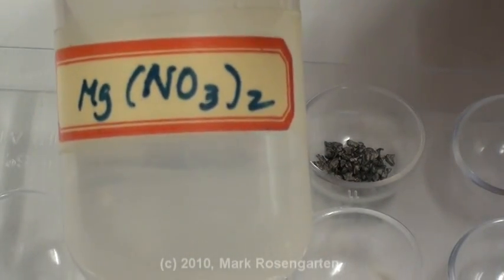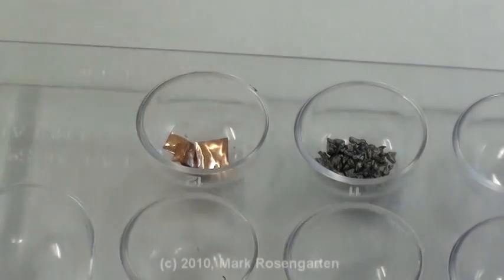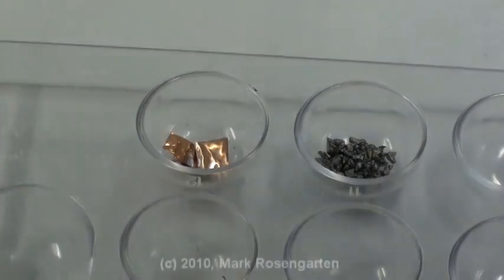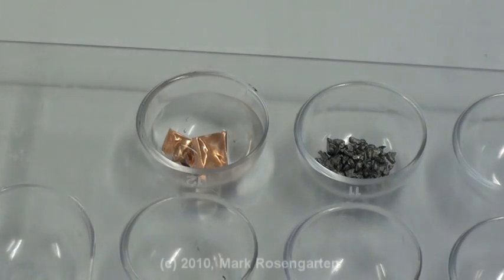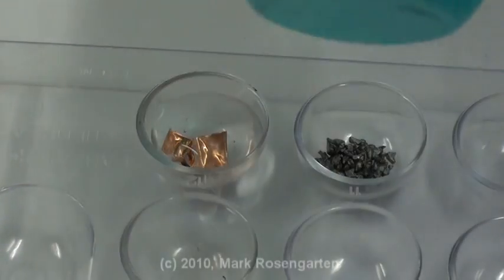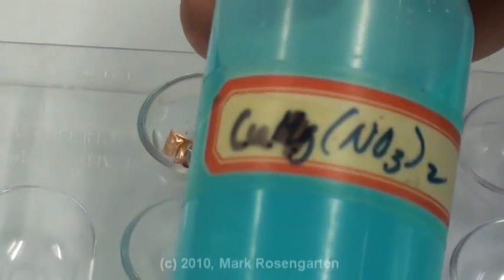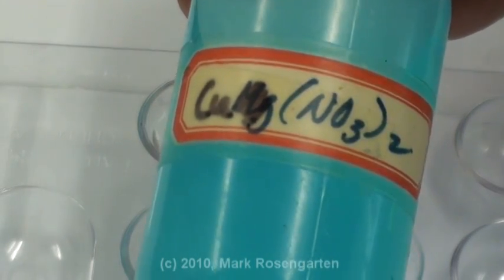First I will add magnesium nitrate to the copper. And now I'll add copper nitrate to the magnesium.